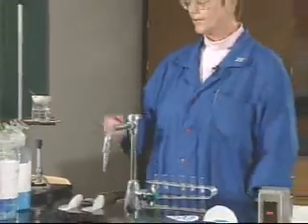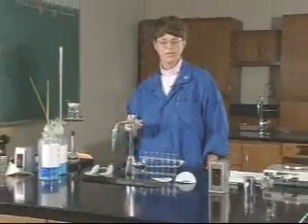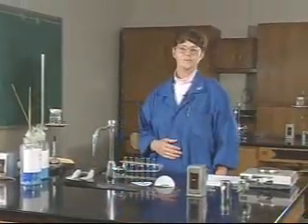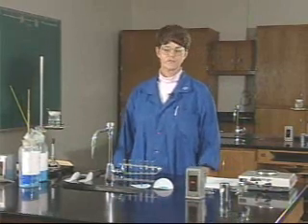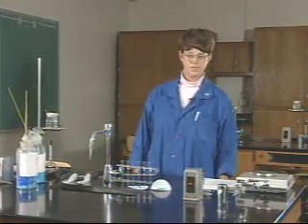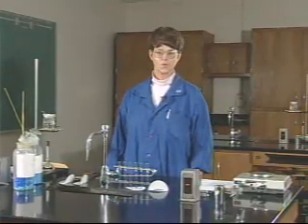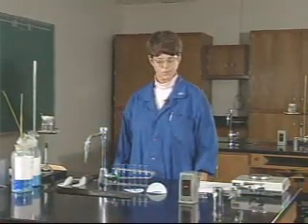While you're heating the evaporating dish for Part A, you can go on and work on Part B. In Part B of the experiment, you'll look at the effect of three factors on solubility: the effect of particle size, the effect of temperature, and the effect of stirring or agitation on the rate of solution.